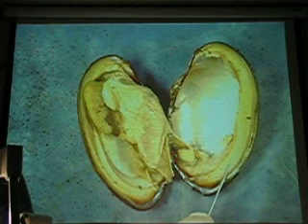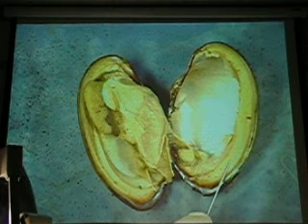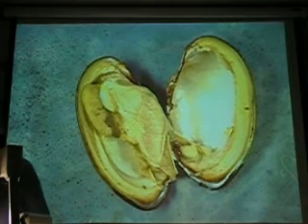And then there's a muscle here too. What is that? Pallial muscle. And then right along here where this pallial muscle attaches — pallial line. And then what's this poofy? The mantle cavity.